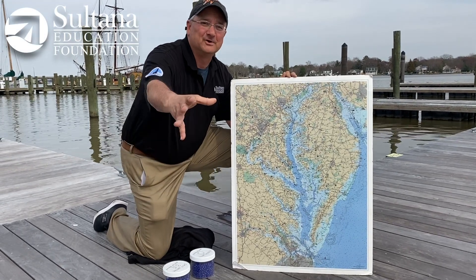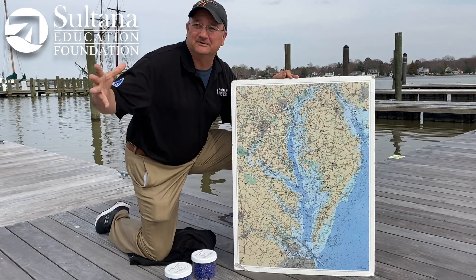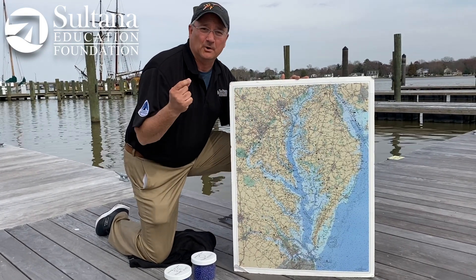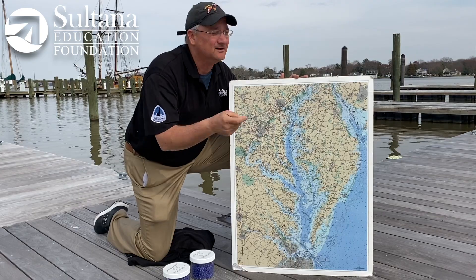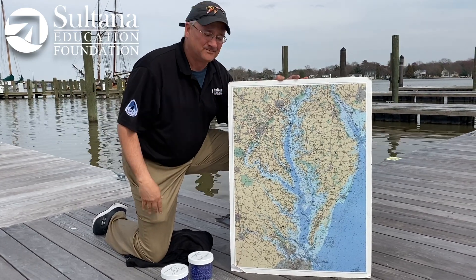Hey everybody, Chris Serino here from the Sultana Education Foundation. I'm sitting here in Chestertown on the Chester River and we're going to do a quick test to measure the salinity of the Chester River here today in mid-March.